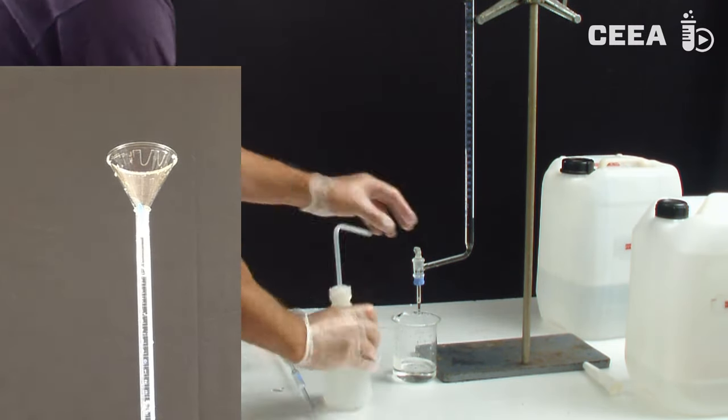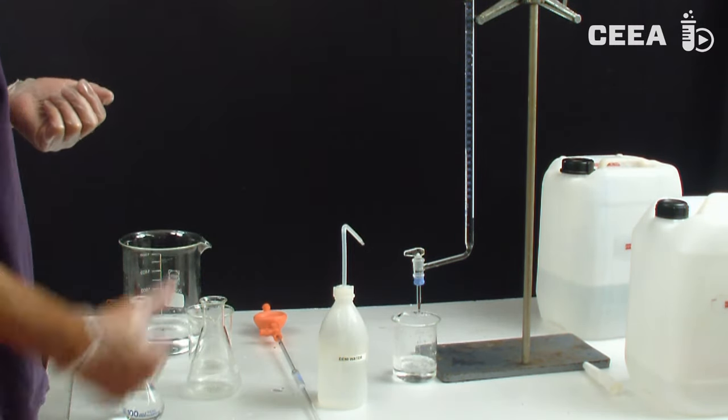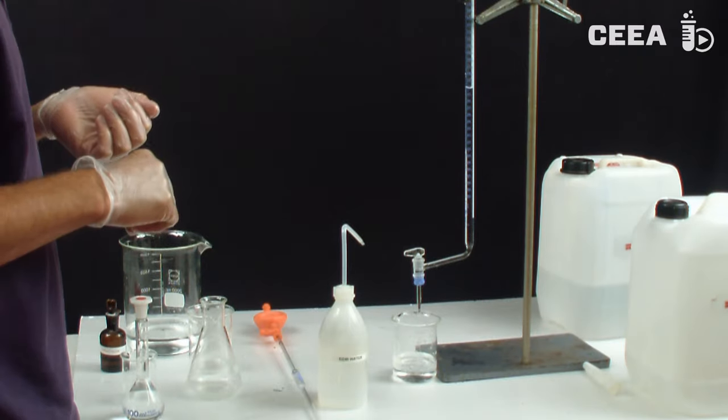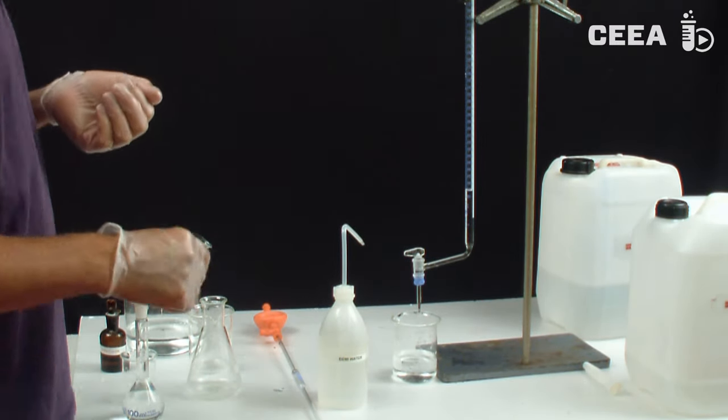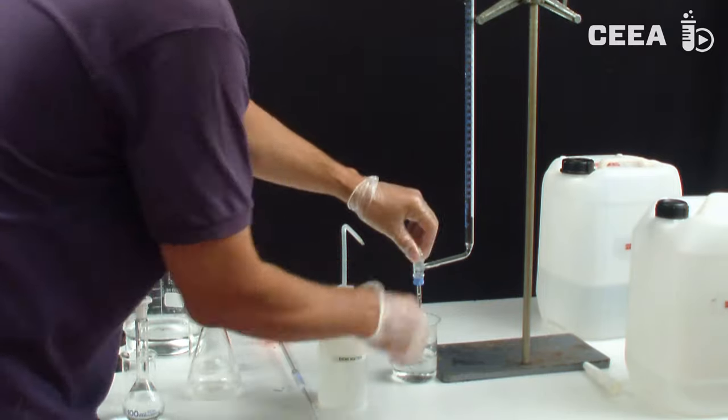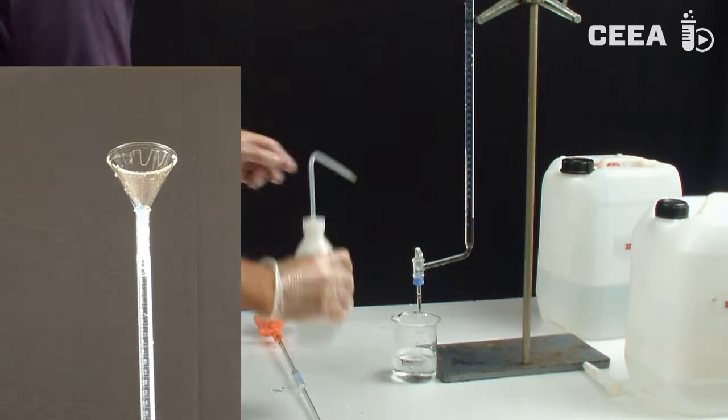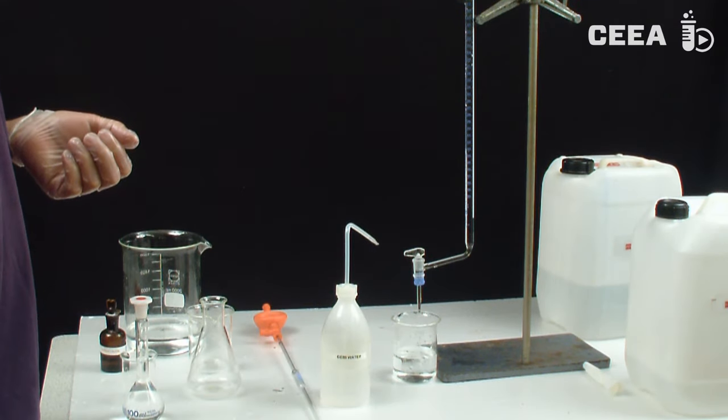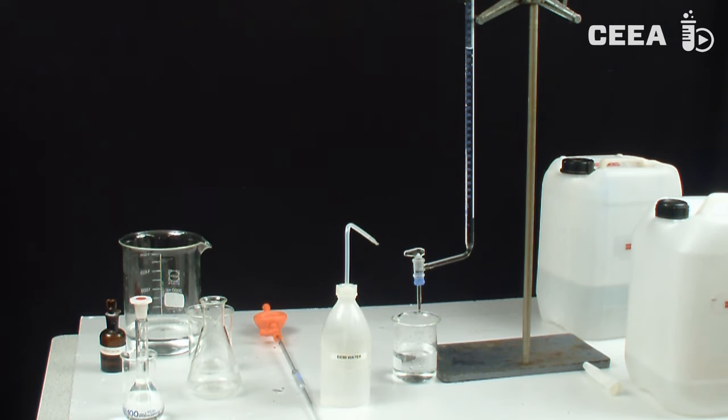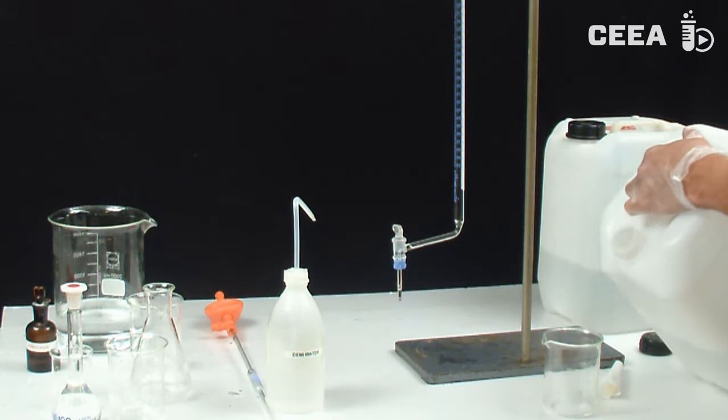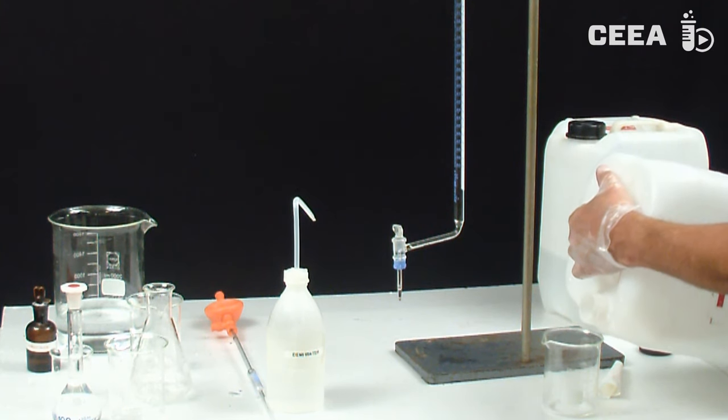Again, the flushing procedure comprises three treatments with demineralized water and three treatments with titrant.